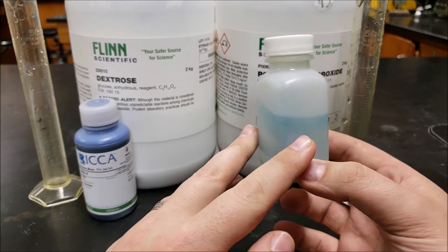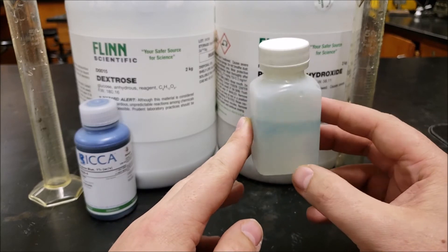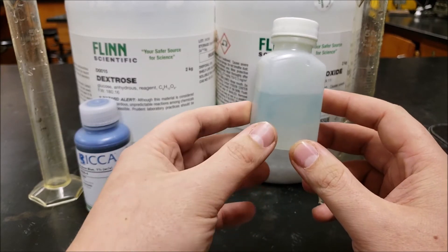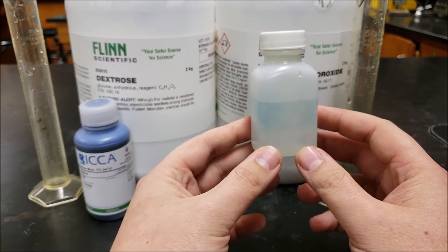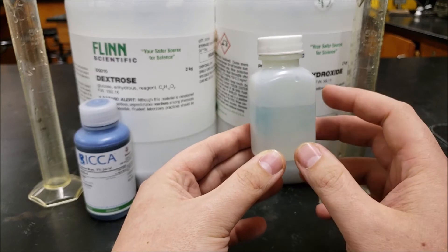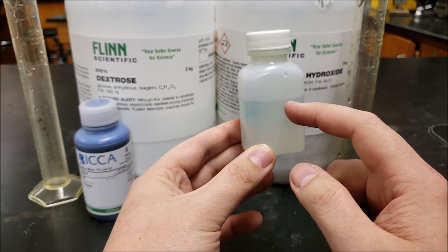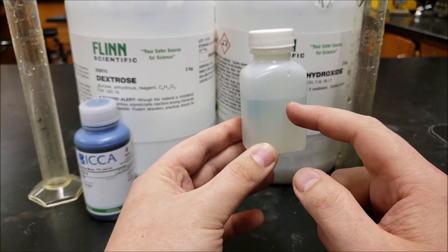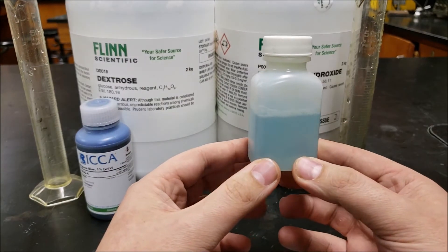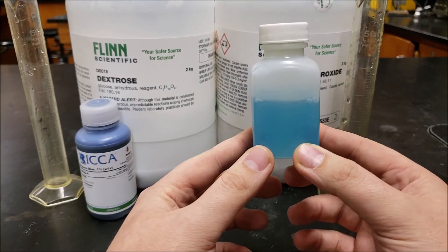When I do this in class I call it 'blue's clues' as to what's going on. The key observations: when it sits by itself it is colorless; when you shake it, it is blue. There's a line of blue on the top, and when you shake it you see some bubbles. All of that helps you figure out what's happening.